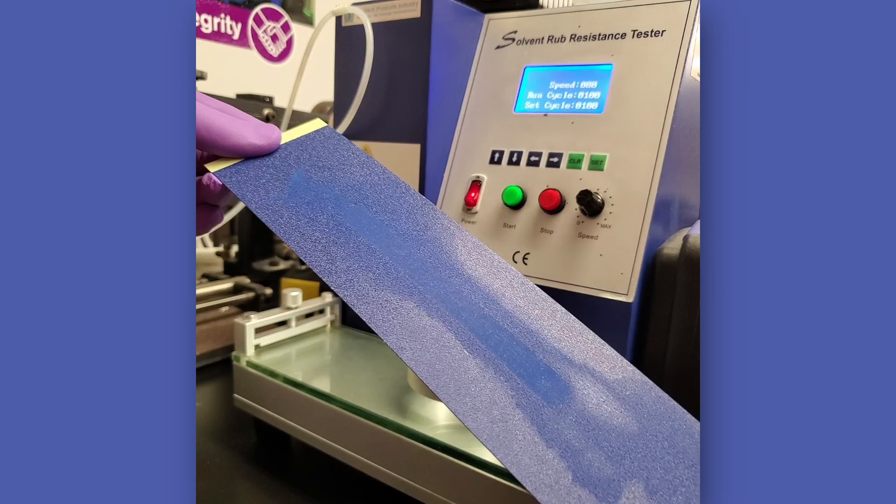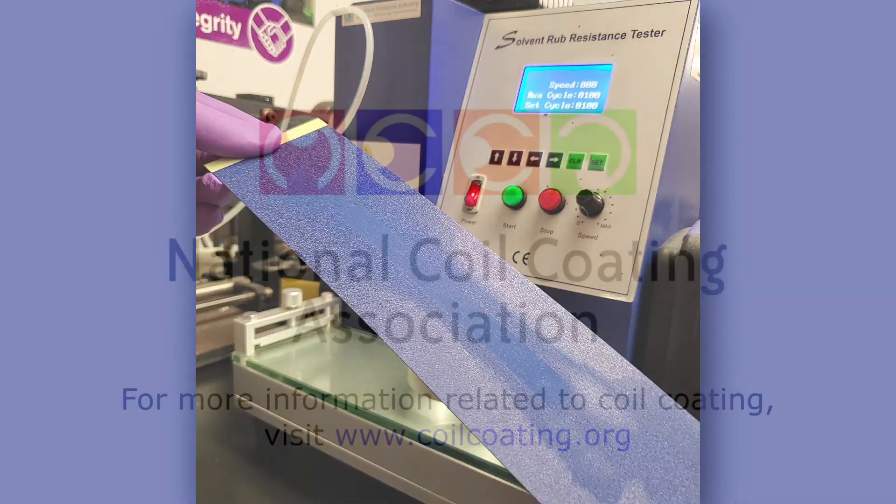If it is necessary, replace the cloth for each test or after a certain number of double rubs as agreed upon between the producer and user. Thank you.